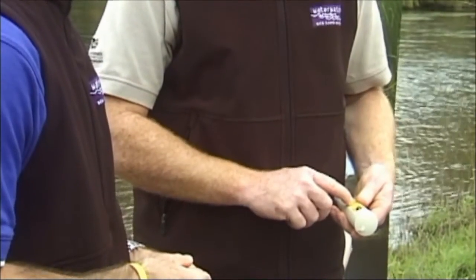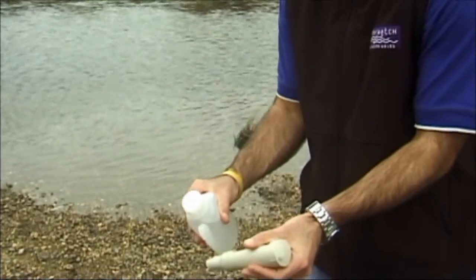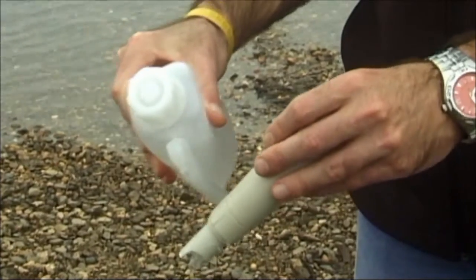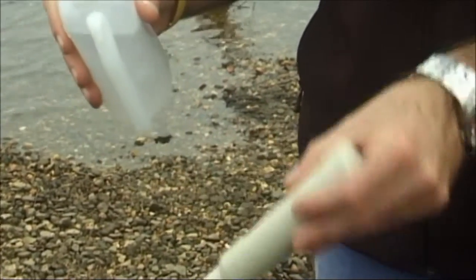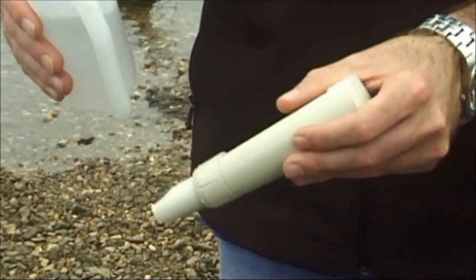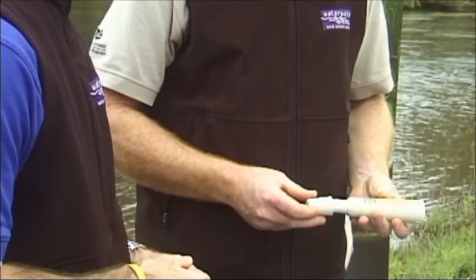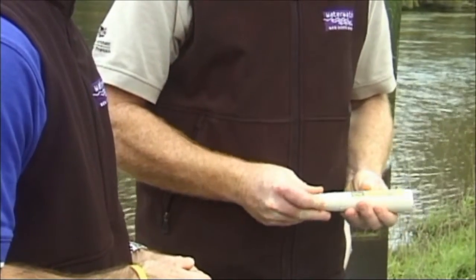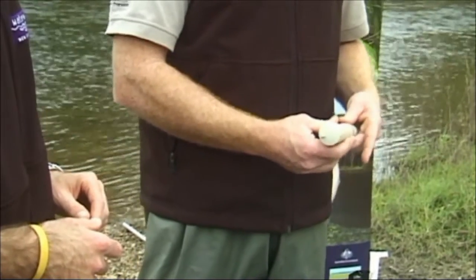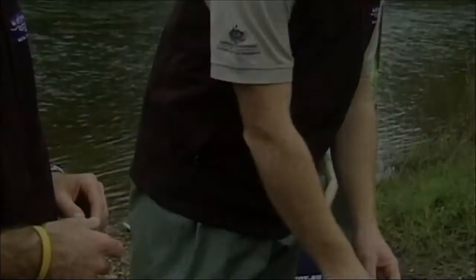Turn the meter off and rinse the probes with deionized water. Shake or allow to dry in the air. You can also wipe the probe with some paper towel, taking care not to touch the metal probes. Replace the cap on the meter. Check that you have switched the meter off and place the meter back in the kit.